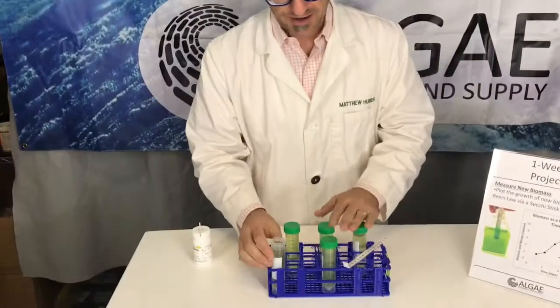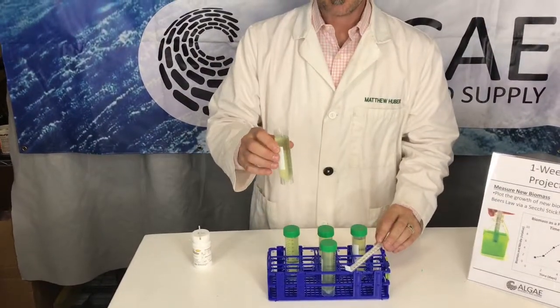Okay, so the first thing you're going to do is start culturing your algae. Those procedures are in other labs that we do.